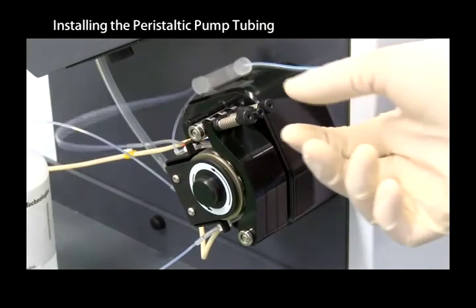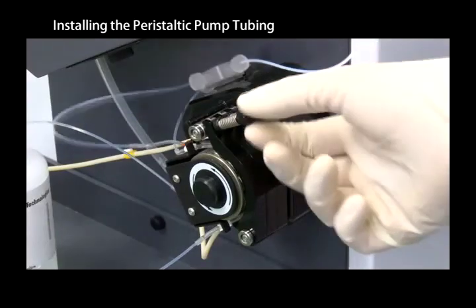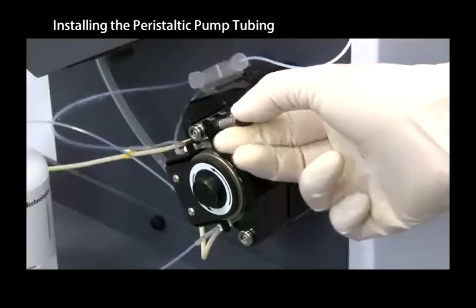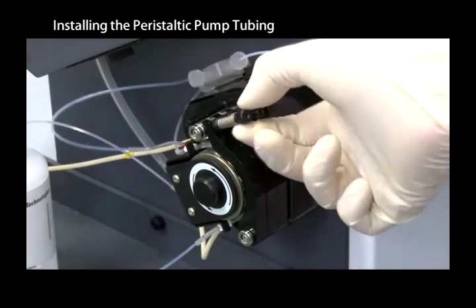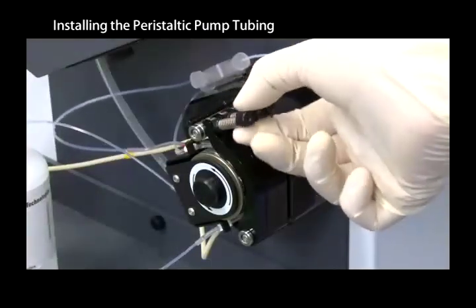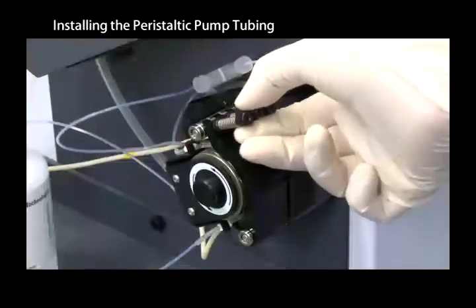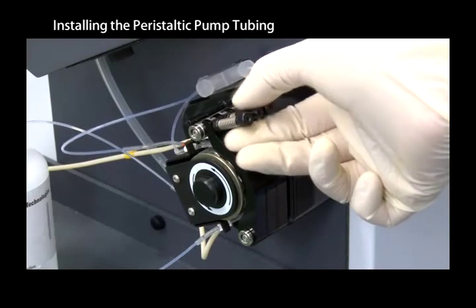To adjust the clamp tension, first loosen the clamp tension until the water flow stops. Next, slowly tighten the knob until the pump draws up the water again. Finally, tighten the sample knob and internal standard knob an additional one to two turns.